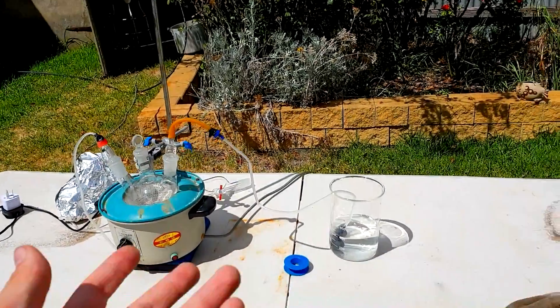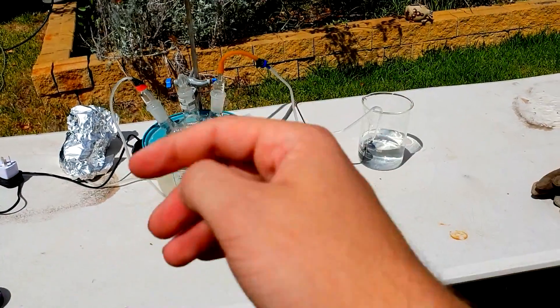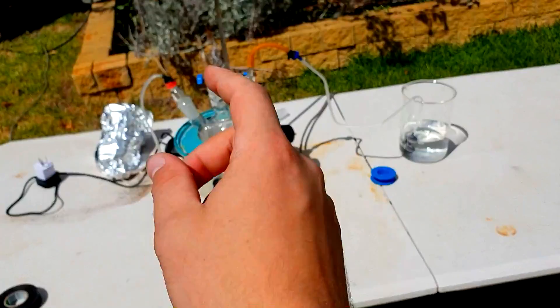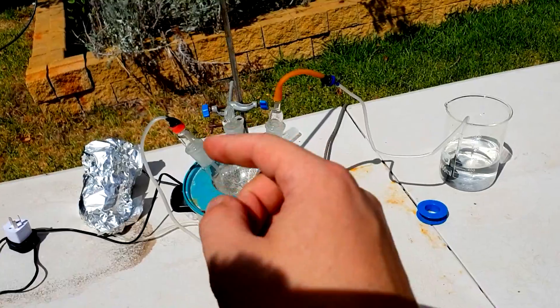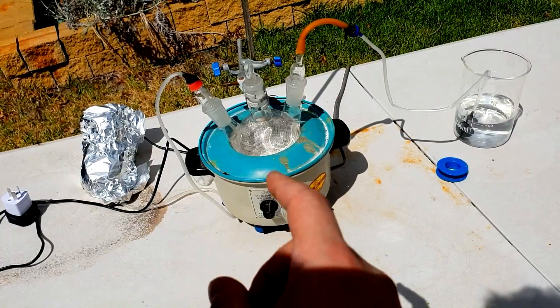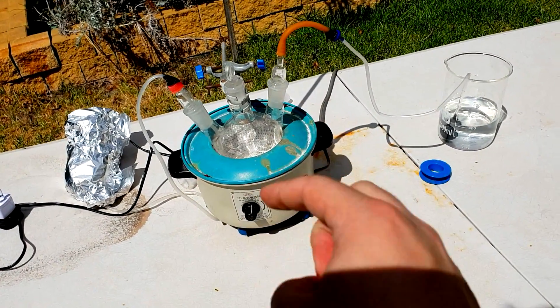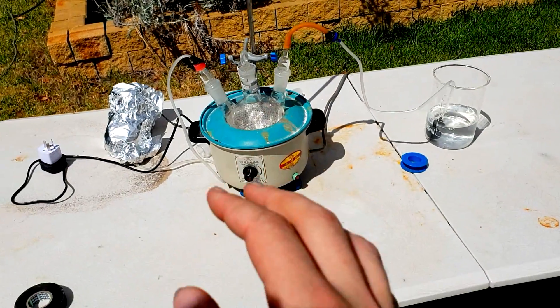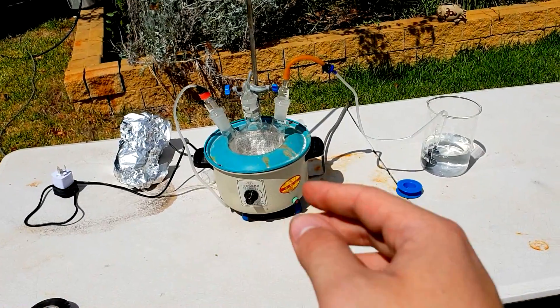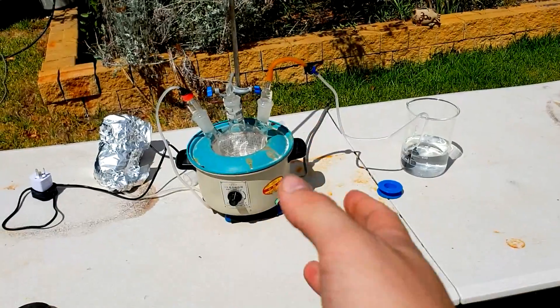What we're going to be doing is making an ammonia solution, and it's kind of already been done in a sense — a lot of people have done this kind of technique, and I'm not doing anything particularly new, but I thought I'd make the video for a couple reasons. First of all, if I have to suffer, you have to suffer. But also, because the gas is actually quite a bit of a shit to deal with, I've gone overboard with trying to make it nice to deal with, and I wanted to show you what I've been doing, and hopefully if it's a lot nicer, then maybe you might think about doing this instead of the standard technique. Anyway, let's get to it.